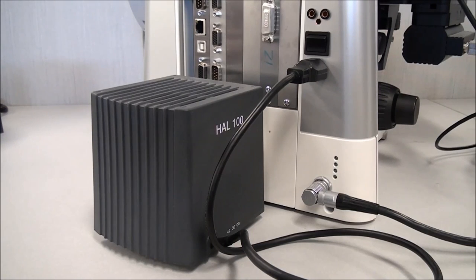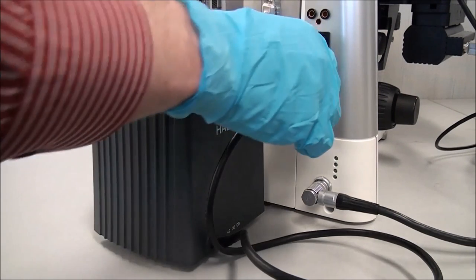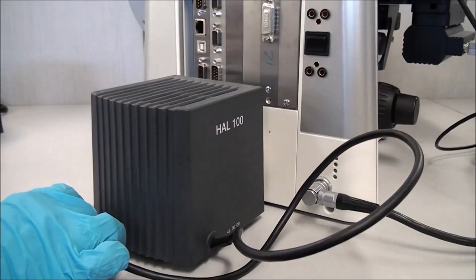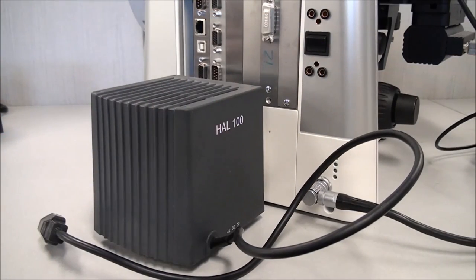Unplug the HAL illuminator from the microscope stand. Take note of which port you remove this plug from. You don't actually need to remove the lamp housing from the stand.